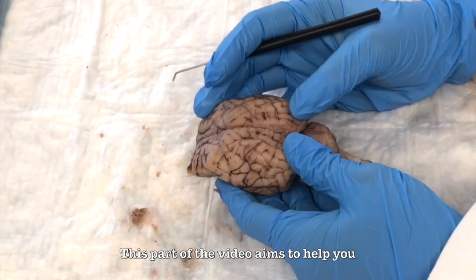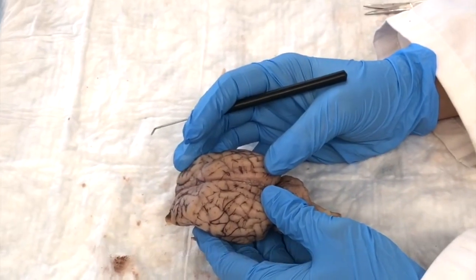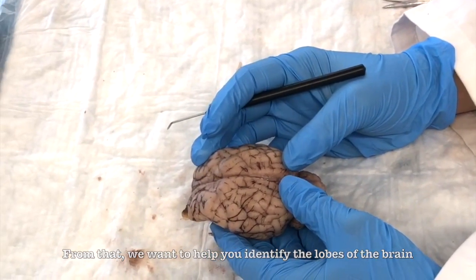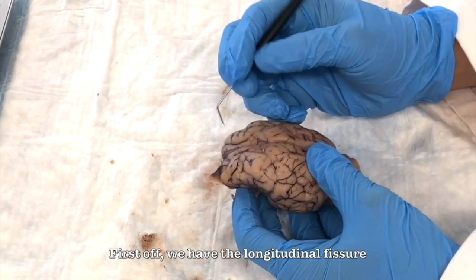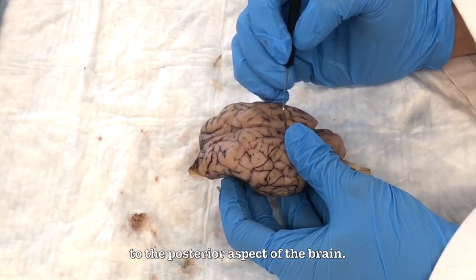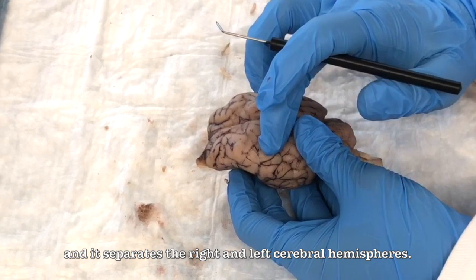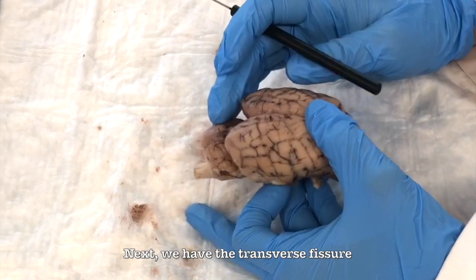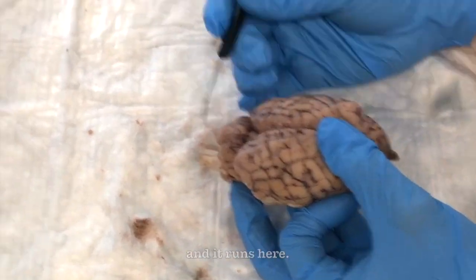This part of the video aims to help you identify the various fissures and sulci of the brain. From that, we want to help you identify the lobes of the brain and their associated functions. First off, we have the longitudinal fissure running anterior to the posterior aspect of the brain, and it separates the right and left cerebral hemispheres. And then we have the transverse fissure, which separates the cerebrum from the cerebellum, and it runs here.